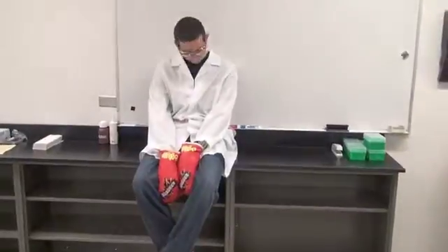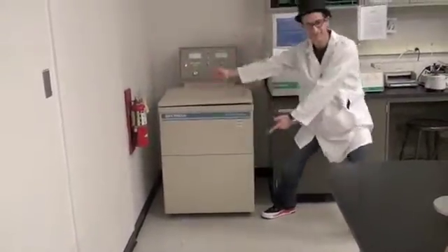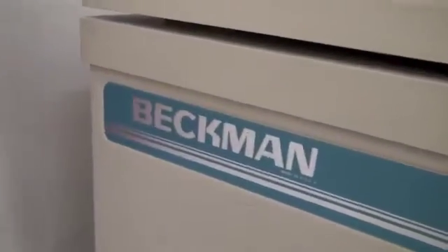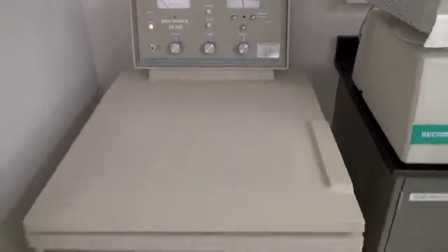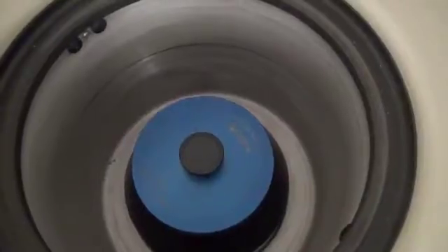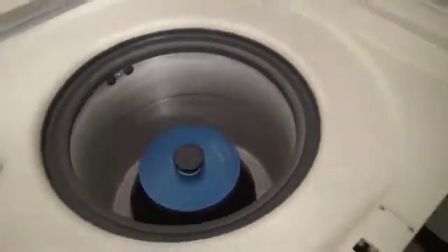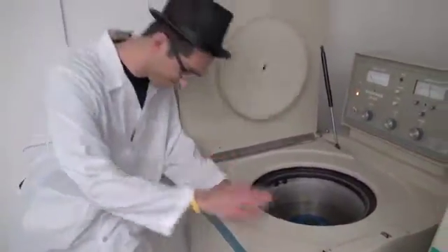The competitors are now ready for their first purification step, centrifugation. Behold the Beckman J2HS. This high-performance centrifuge has a maximum speed of 21,000 revolutions per minute and 200 RPM speed control. With the right rotor, you can spin up to 3,000 milliliters of solution with this 220-volt, 656-pound monster centrifuge. You can spend less time waiting for separations, reduce degradation with the built-in refrigeration unit, and feel comfortable and secure around the kids, knowing that the door cannot be opened while the rotor is spinning.